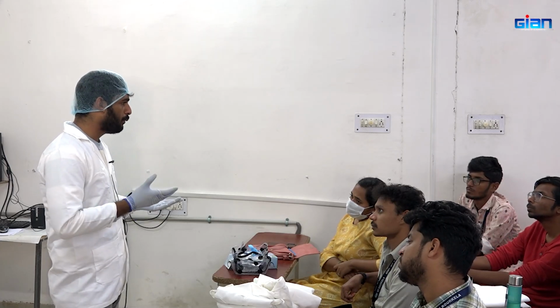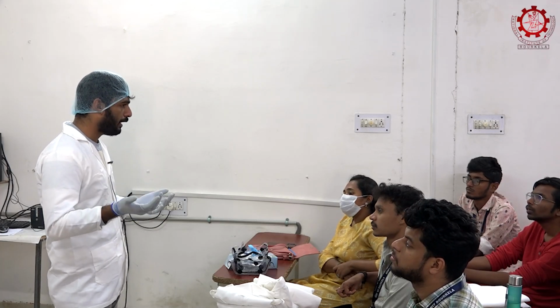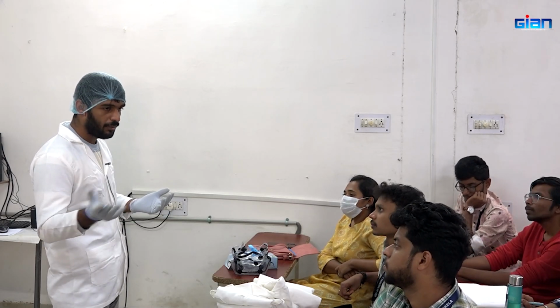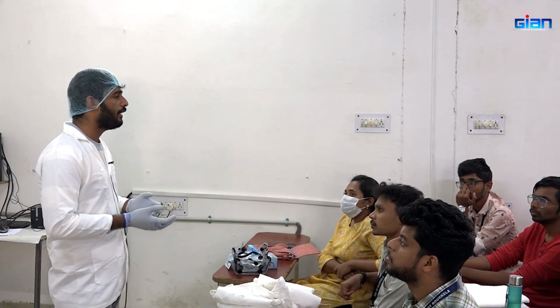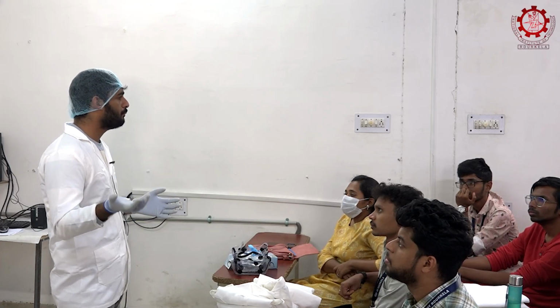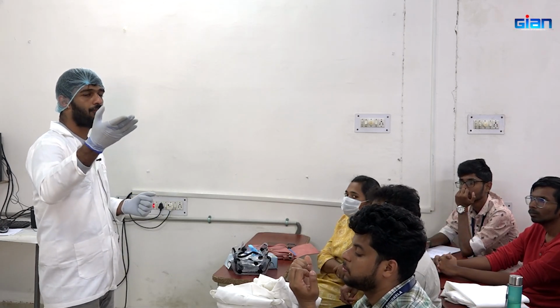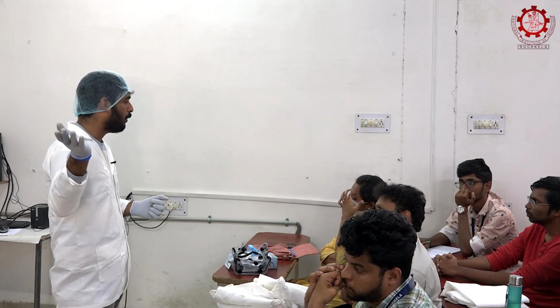Initially after demineralization, this HCl soluble portion, the acid soluble fraction, if we want calcium chloride, we can dry it and we will be getting calcium chloride, because when calcium carbonate reacts with any acid, we get its chloride salt. For example, if we use HCl, we will be getting calcium chloride. If you are using acetic acid, then we will be getting calcium acetate. So for making the calcium chloride, we have also already kept it for drying.